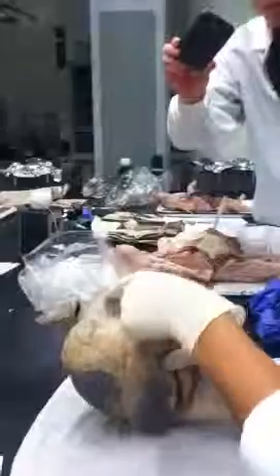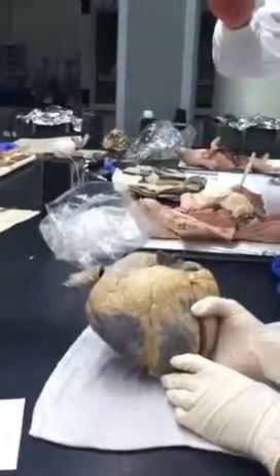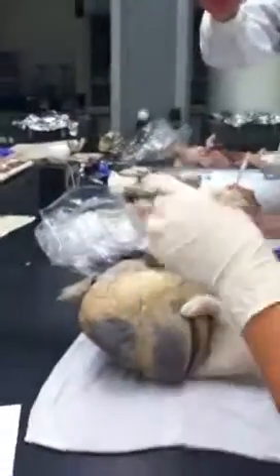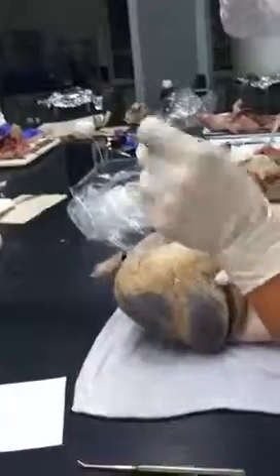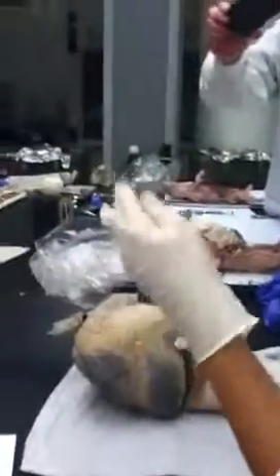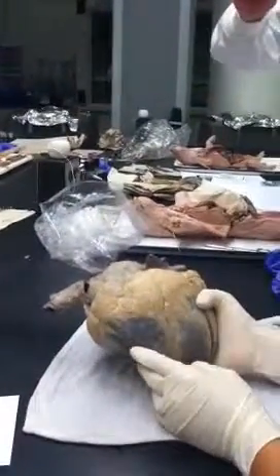Anyone know what this thing is? That's the pulmonary trunk. Yeah. So when you look at your fetal pigs, the big white thing coming out of it is kind of the most notable thing that you can see. That's the pulmonary trunk, and it kind of crosses over.